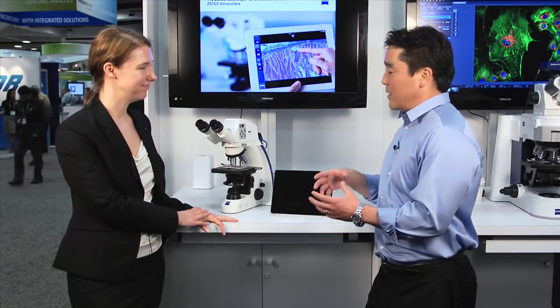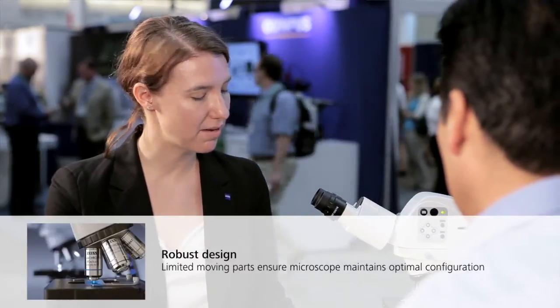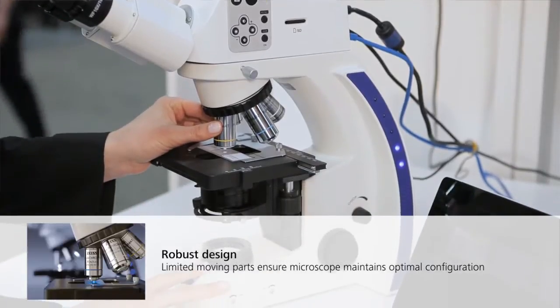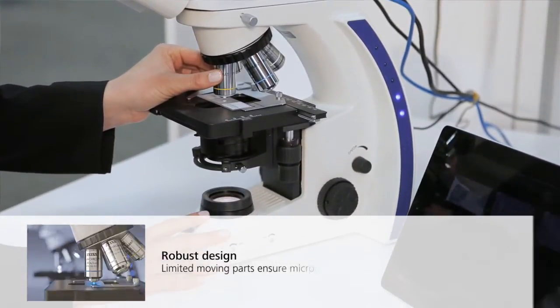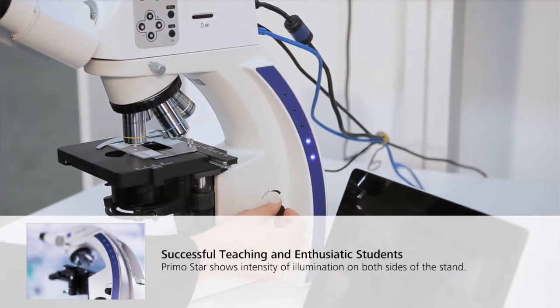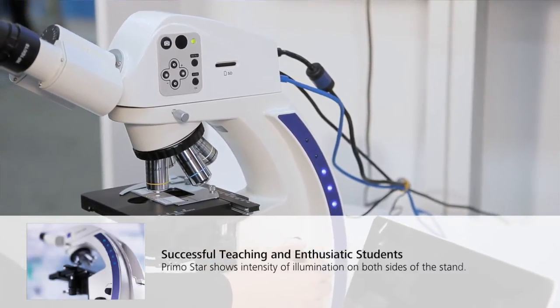When you're building a microscope for a classroom, there are probably some features you want to focus on specifically for student needs and the needs of the classroom in general. What are some of those features? The microscope is designed to be very robust. It has limited moving parts so students can't mess up the configuration, including the objectives which are semi-locked into place to prevent inadvertent removal. Also, you can see here how much illumination the student is using based on this illumination panel — from far away, an instructor can see how little or how much illumination a student might be using.